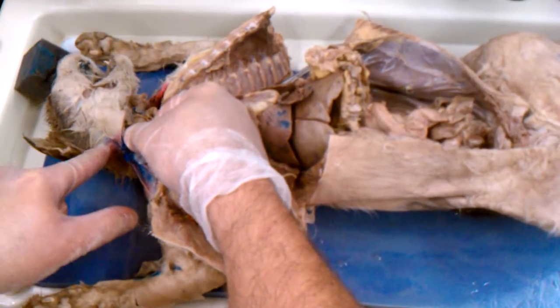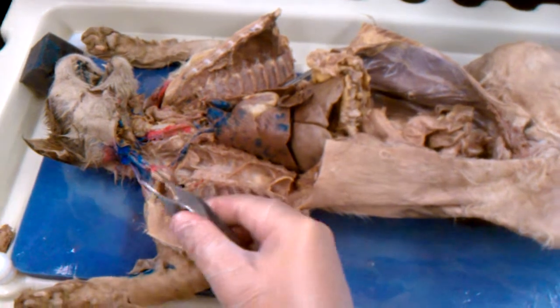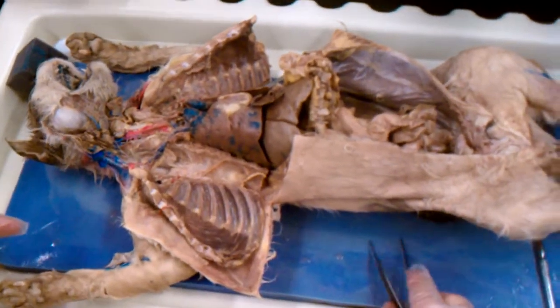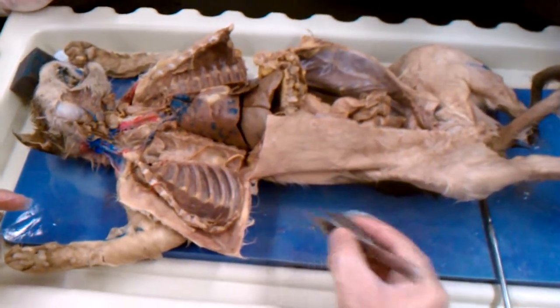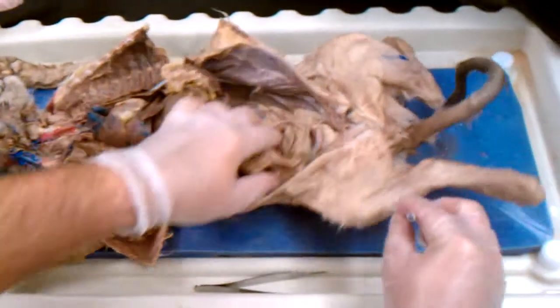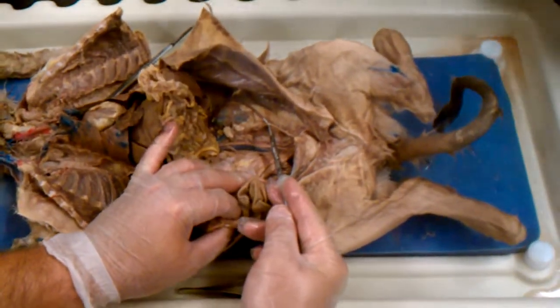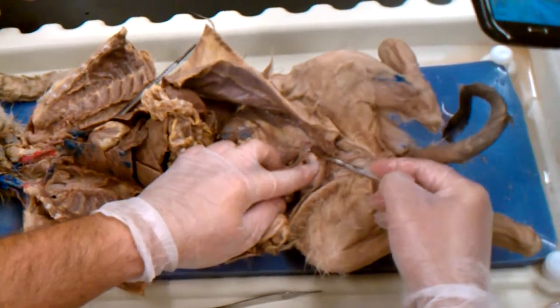I mean, the dissection for the cat and the final is not hard. Because the only other thing, kidneys, ureter. It's a boy cat, right? So wrapping around the ureter, right here, vas deferens, going from the scrotal sac up next to the testicular artery, right there.